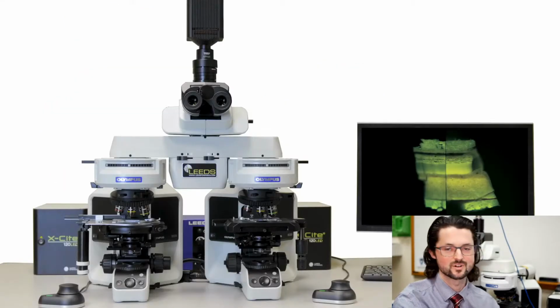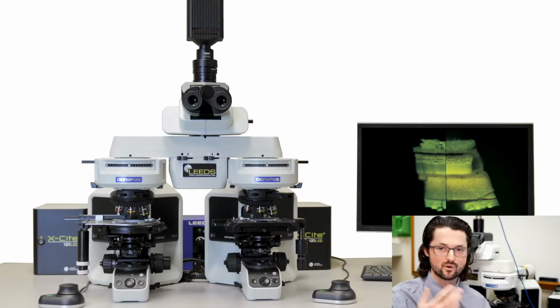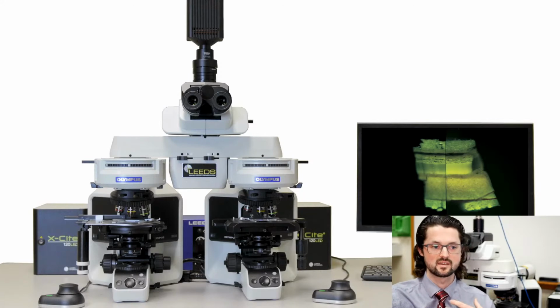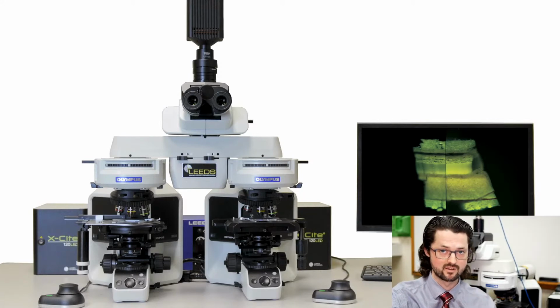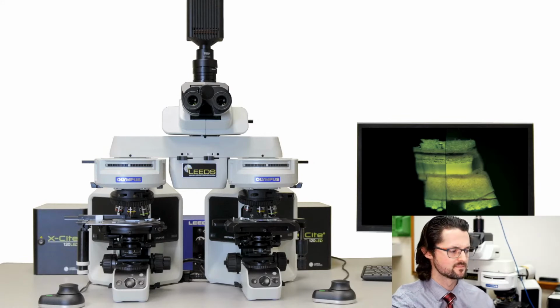So, the long and the short of it is, if you're looking at a new comparison scope or you're looking to upgrade a comparison scope, the LEDs now are really powerful. They give you all the fluorescence you'll need, plus they give you constant color rendering and allow you to do some techniques that might not have been feasible before without a significantly bigger budget. So, hope I didn't rush through things.